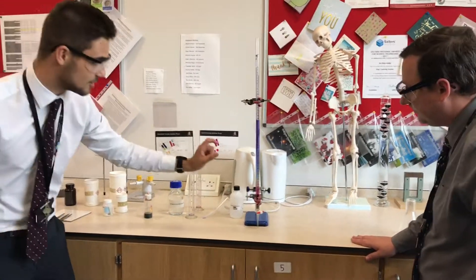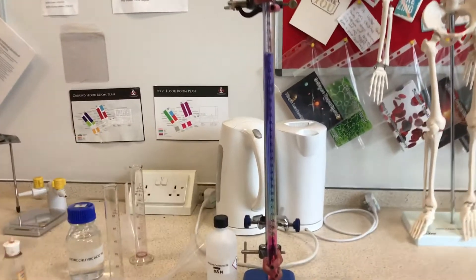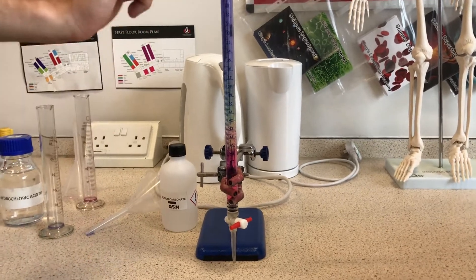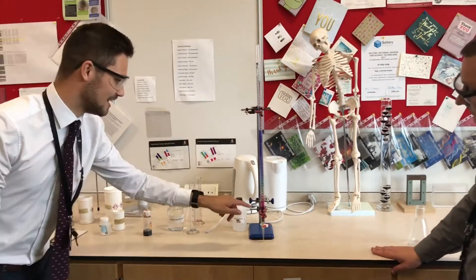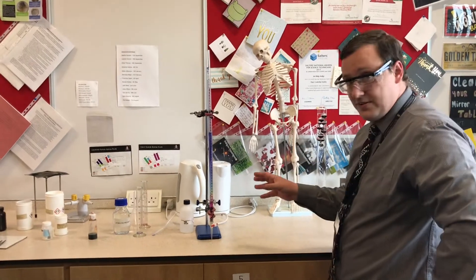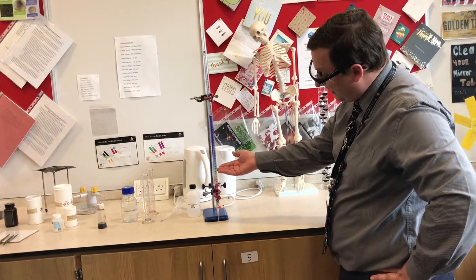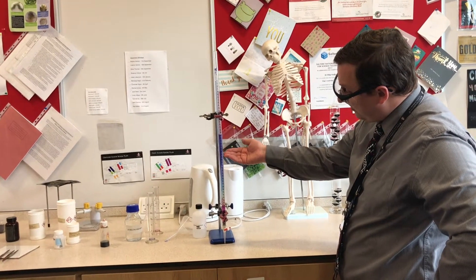Hopefully you can see now that this band of green was once quite small but is slowly growing. And actually it's not just green — we've got yellow, orange, and even a lighter blue before we go into this darker purple. Any ideas what each of these mean, Mr. Walker? Well, we've basically made a pH scale — pH 1 going through 2, 3, 4, 5, 6, 7 about there in green, and then 8, 9, 10, possibly 11 up to 12 maybe up here.